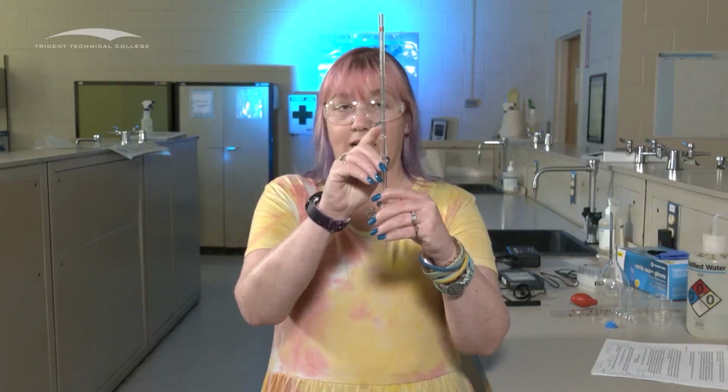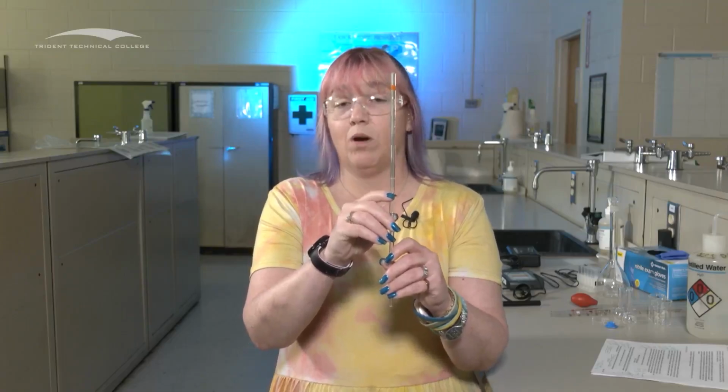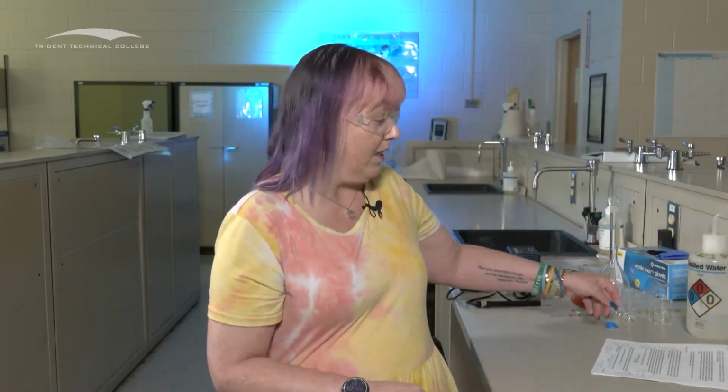We know exactly what that is, and so if this is a 1 milliliter pipette, we know that this is 1.00 milliliters. That's the precision that we know for that particular instrument. So the type of instrument that we're dealing with will tell us what kind of precision we have for that number. It's important that you pay attention to that and record exactly what it is. You will see that when we're in ALEKS, it will be very specific about that. So if you don't have the right number of numbers, that's going to be a problem.